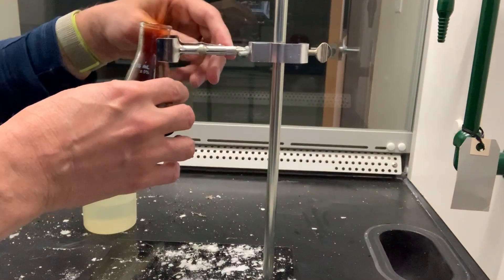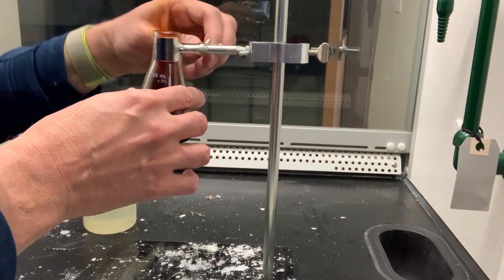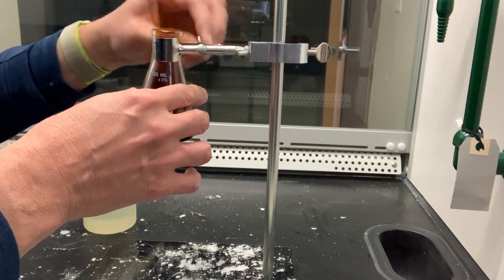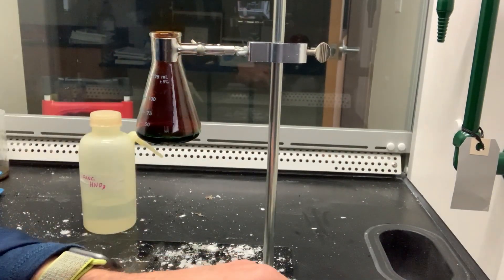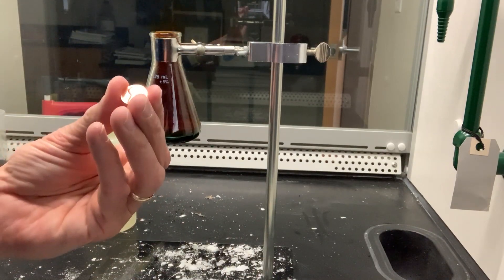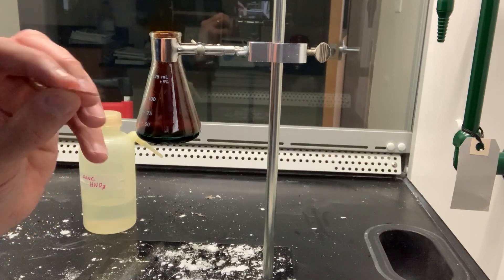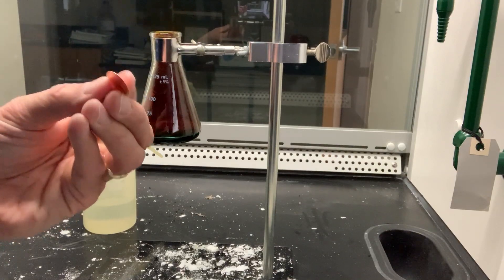And the penny, which you can't see right now—but I had previously done this experiment for another class, and I saved the penny after I cleaned it off. It ends up looking like this. It's very shiny. In fact, if you look at it carefully, it's very sharp around the edges because the outside has been dissolved by the nitric acid.